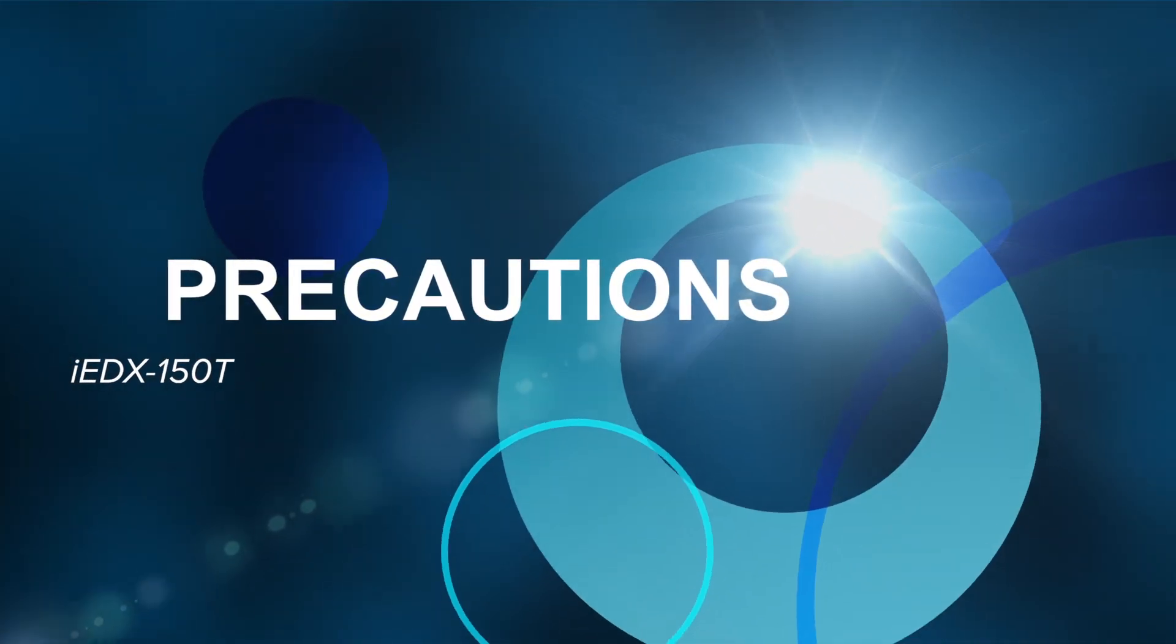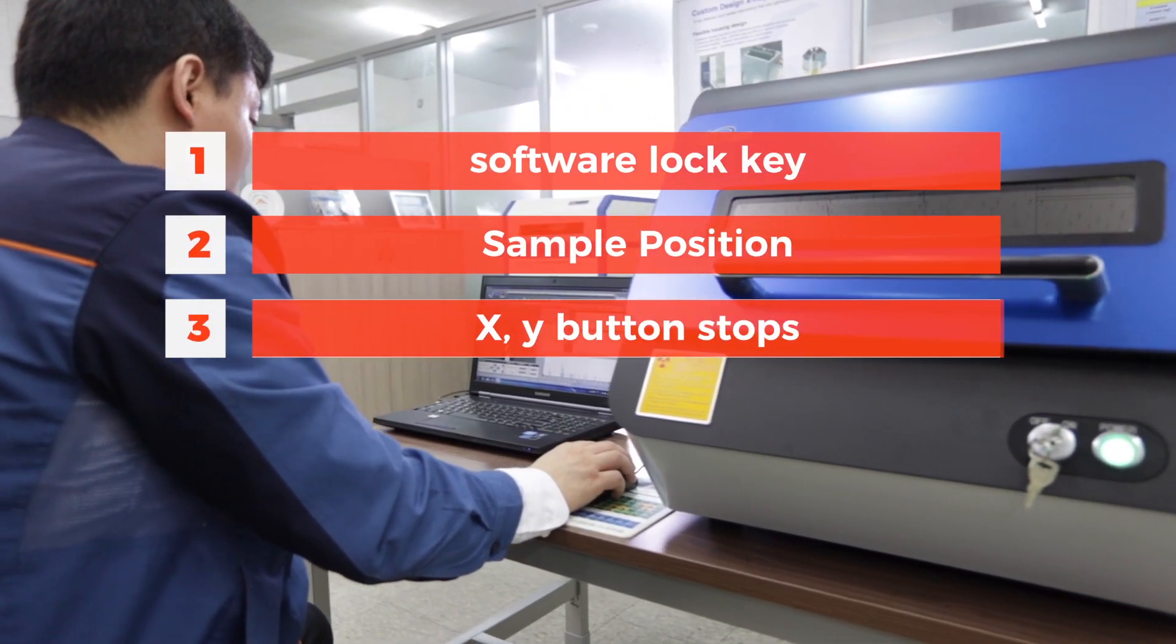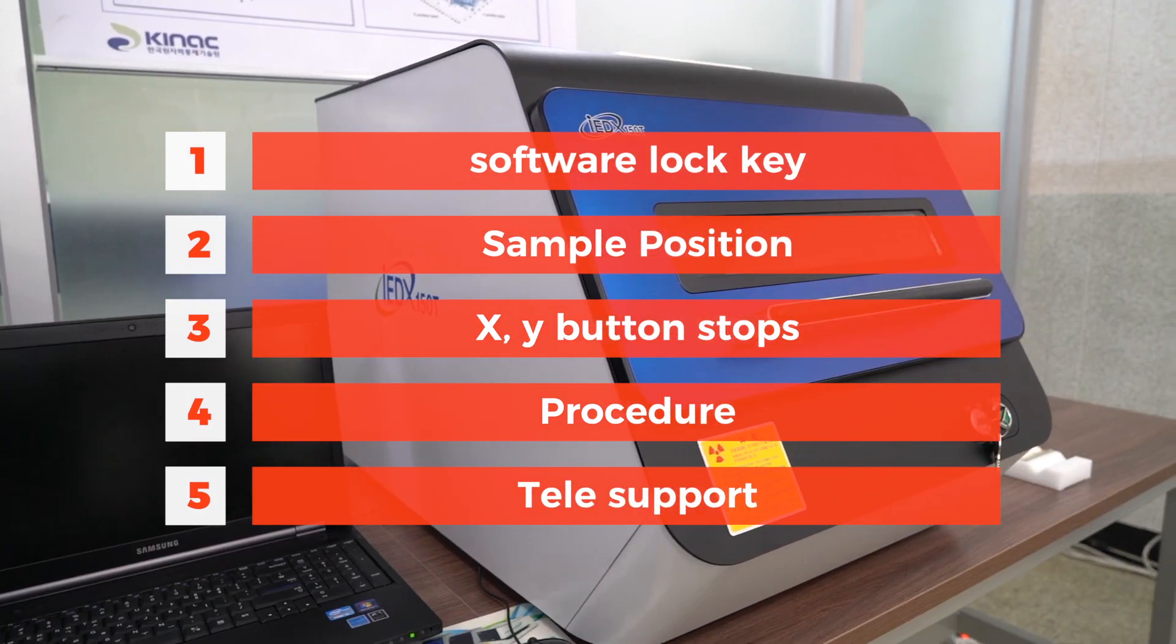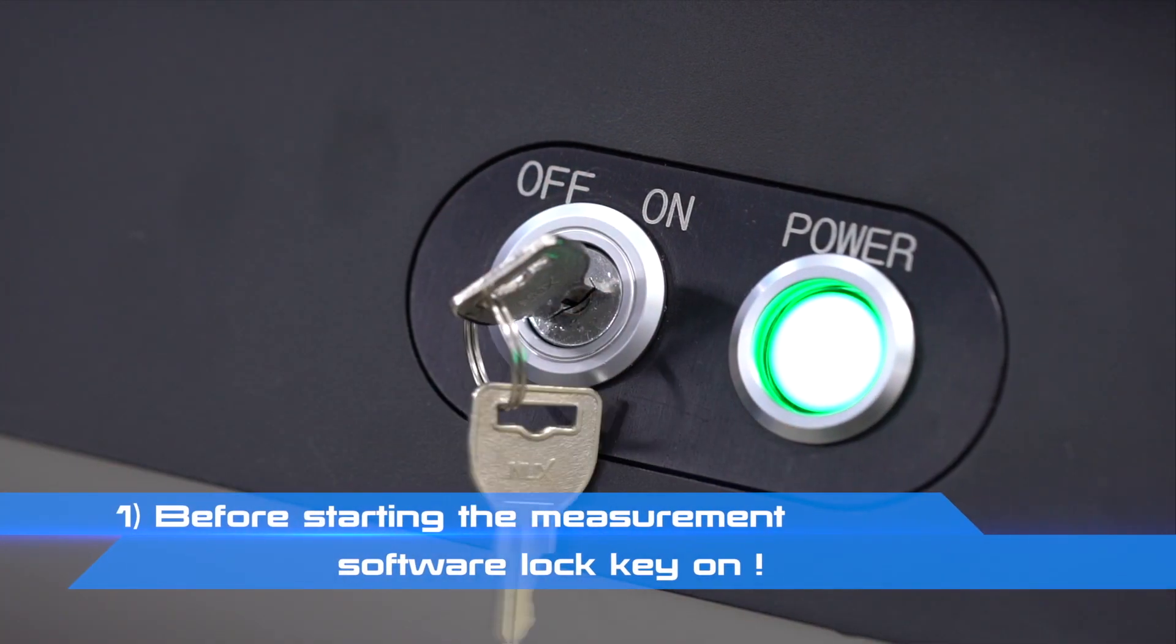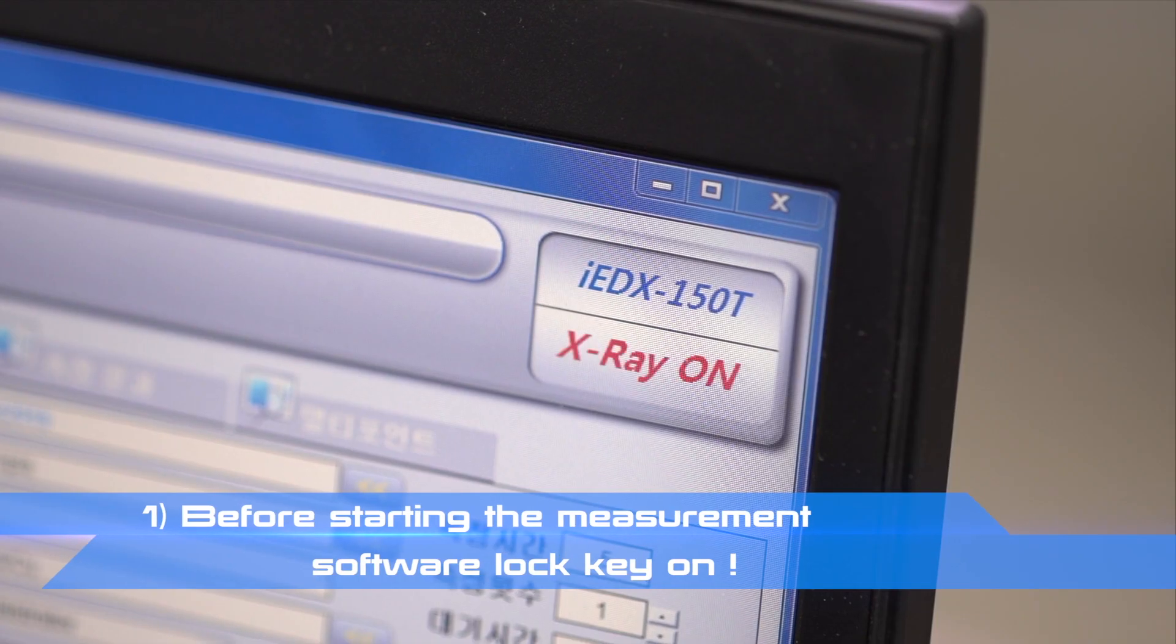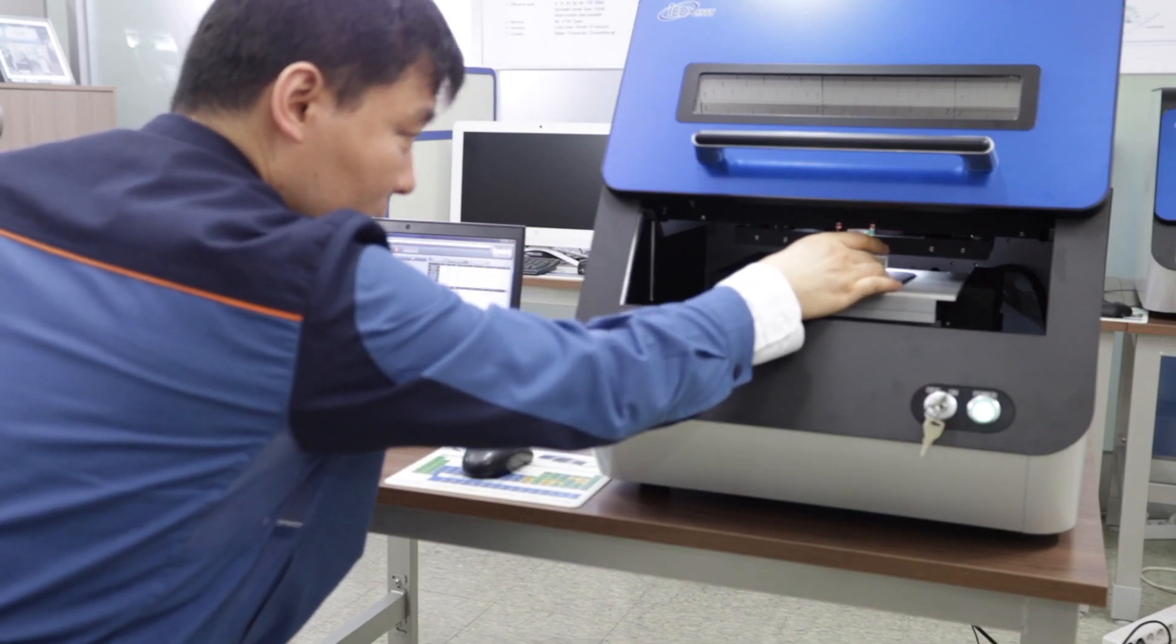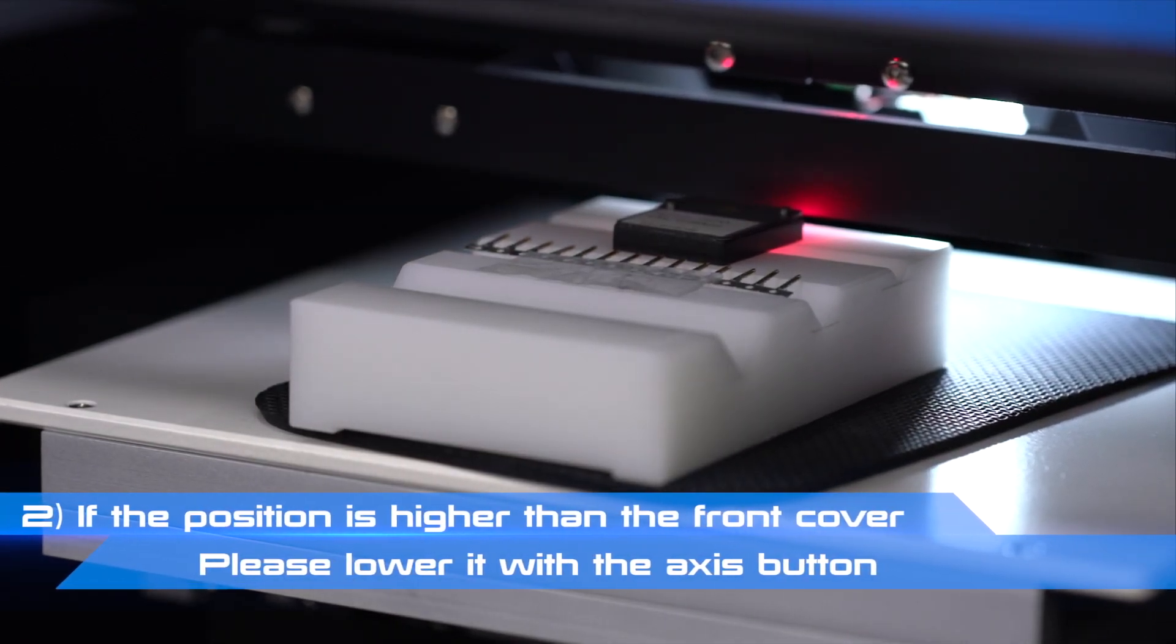Precautions. Please turn on the software lock before starting the measurement.